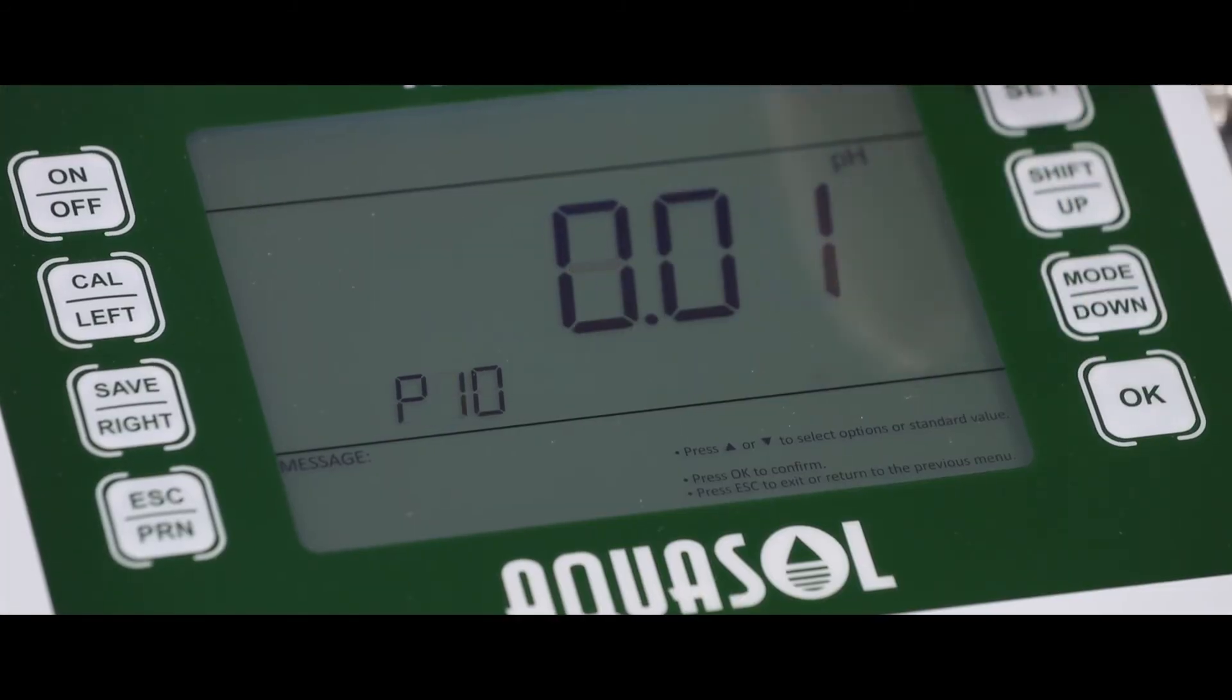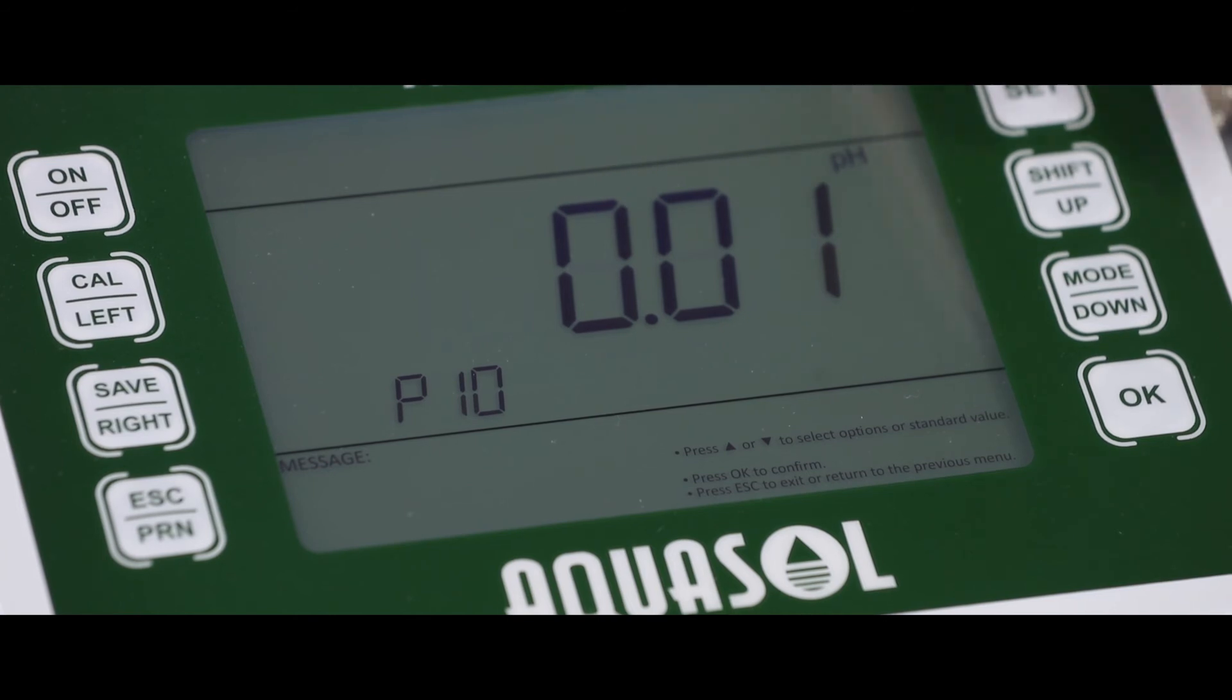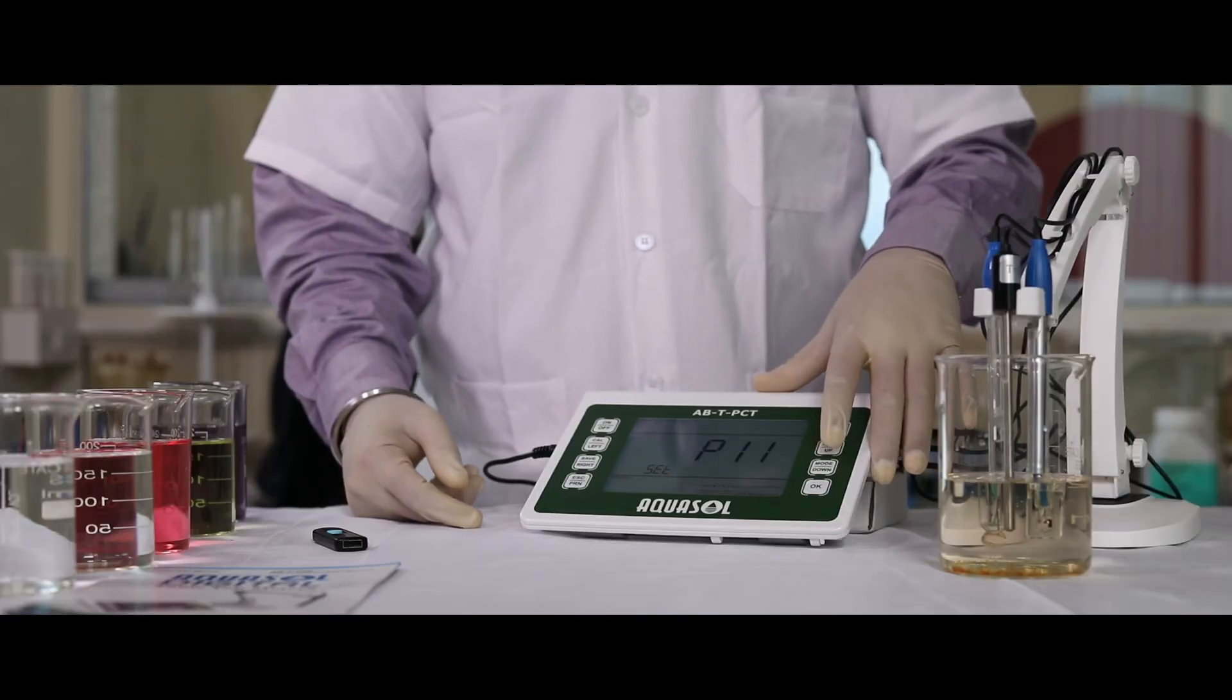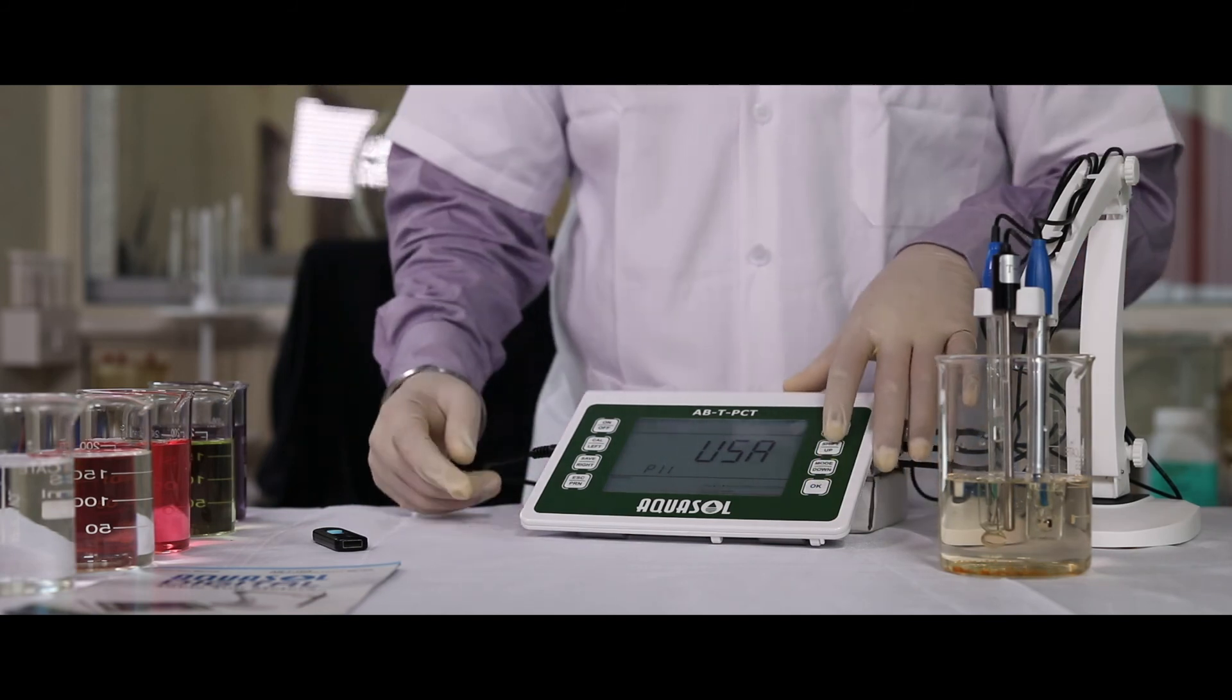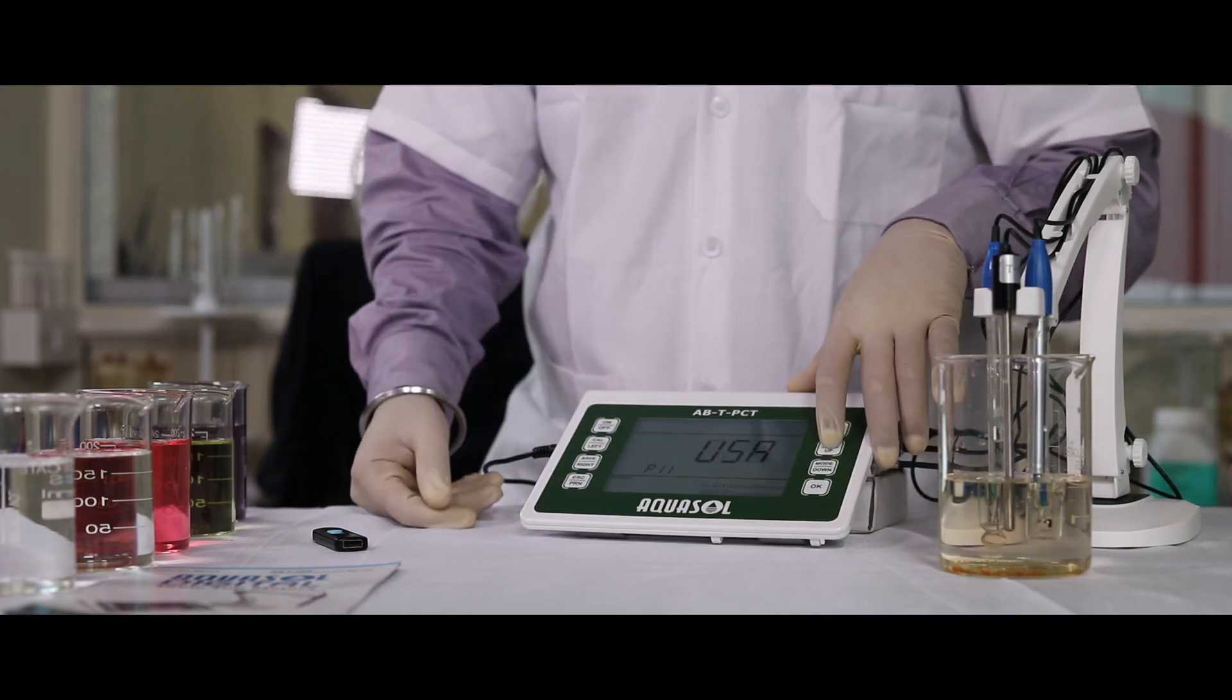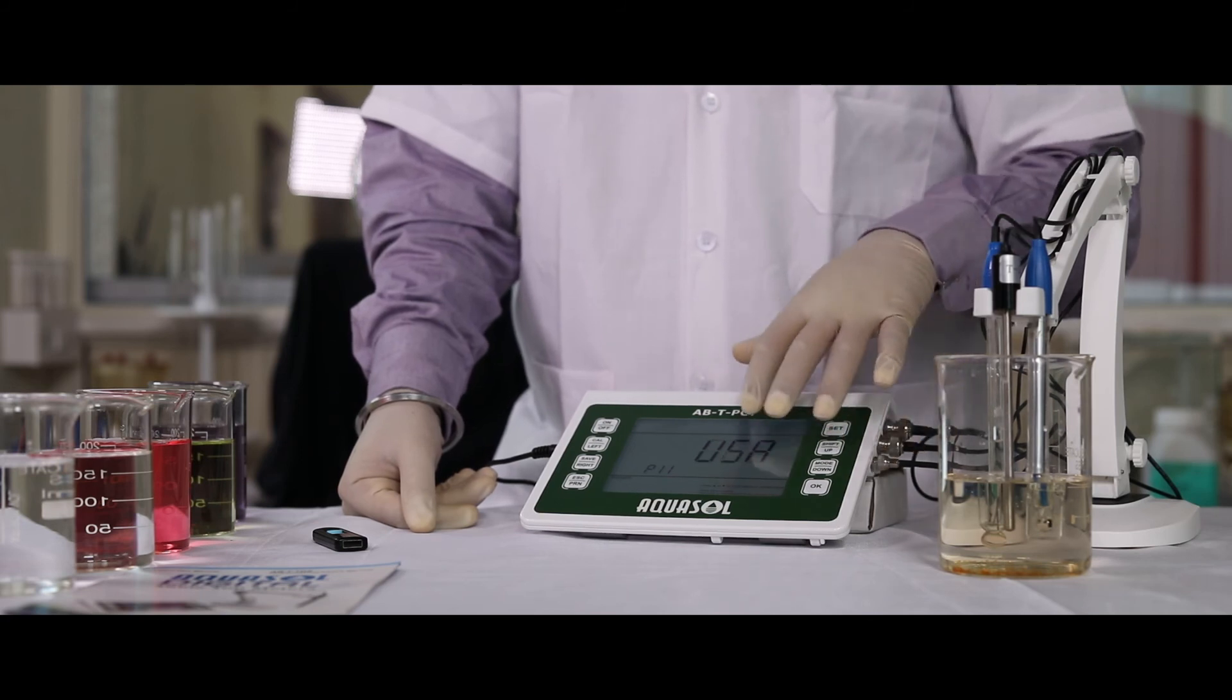P10 to select the pH resolution range. P11 to select pH standard buffer range. USA is the default setting. These are the settings for pH.